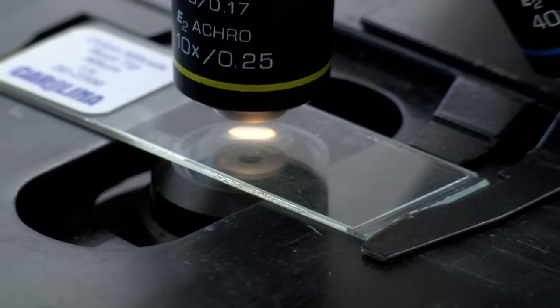When focusing, move the slide just a little bit back and forth with the slide holder knobs. Your eyes can see motion better than stationary objects.